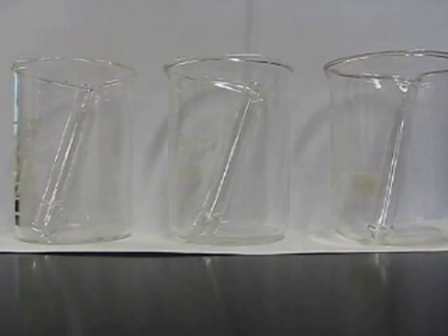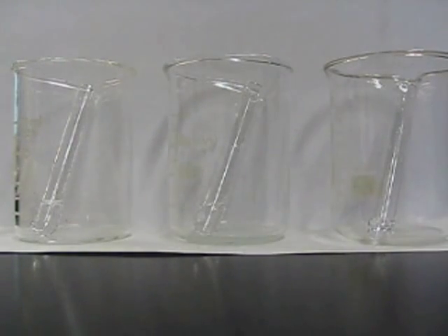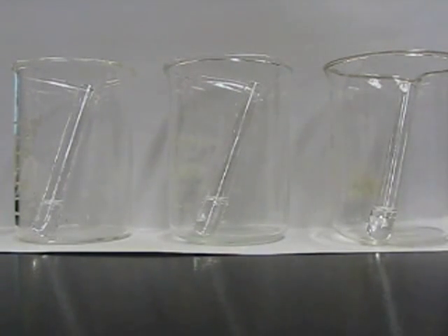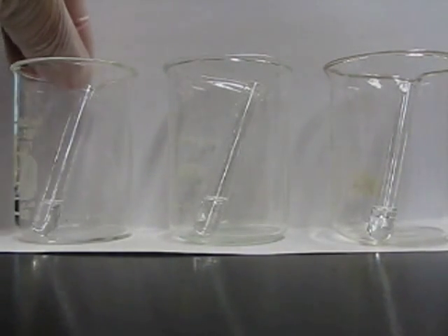What's being added right now is the sodium hydroxide solution, and after this I'm going to do a quick examination to see if the solutions are miscible or not. With these solutions, only in the case of 1-propanol should we see a homogeneous solution. The other two should be heterogeneous with two phases.